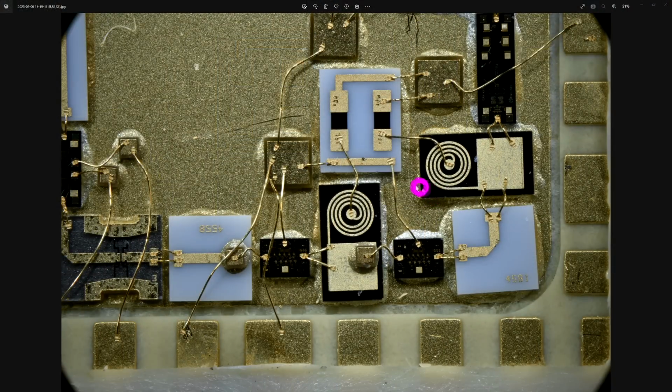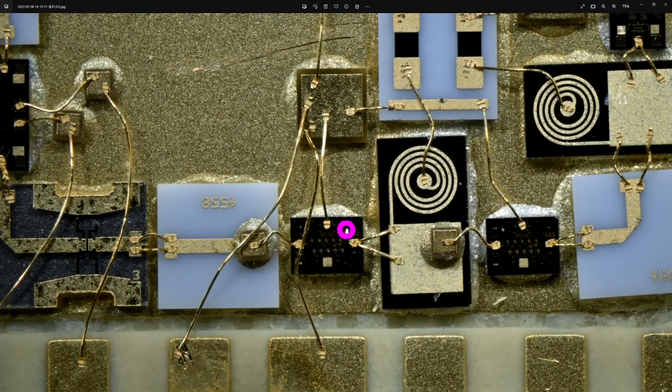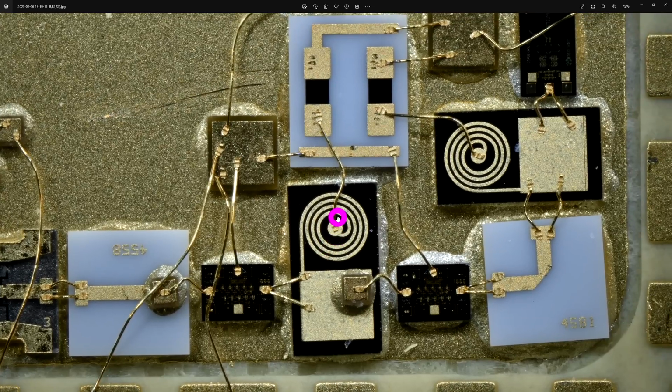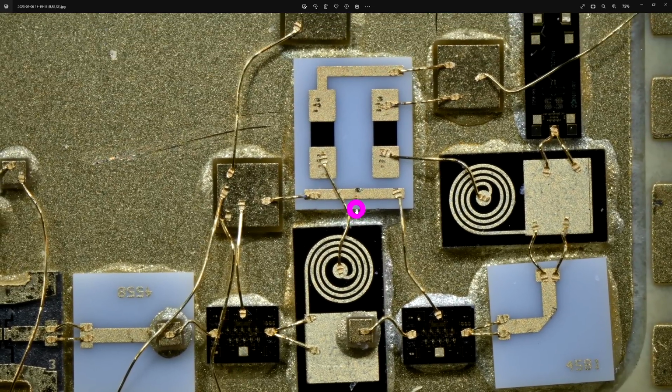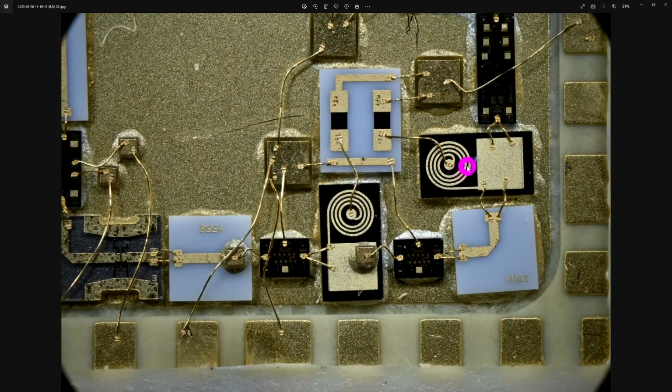And here's a focus stack image. This is only 6 images, so you could do more if you wanted to get even more focusing. And it looks really nice. And one of the nice things about taking images versus taking a video is that you can set your shutter speed to be very, very low. And in dark field, it's hard to capture enough light to do this. So it works really well in that situation, especially when you can let the camera run for a while. You get these beautiful, beautiful images.